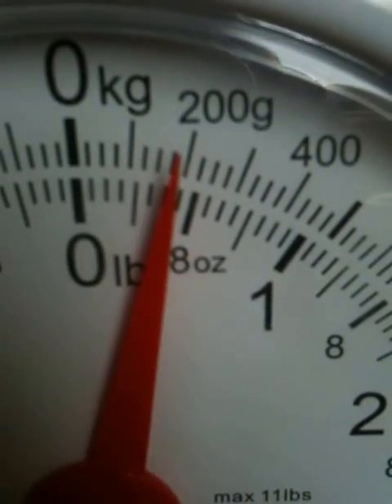I've just collected every little pin I can, and some of them are just pure, pure plated in gold. I'll stick that on my scale — there you go, just under 200 grams.